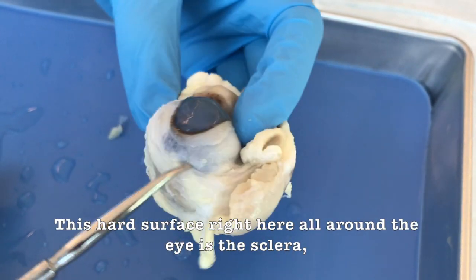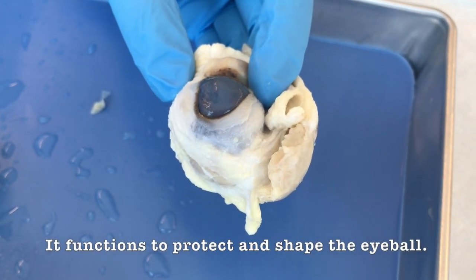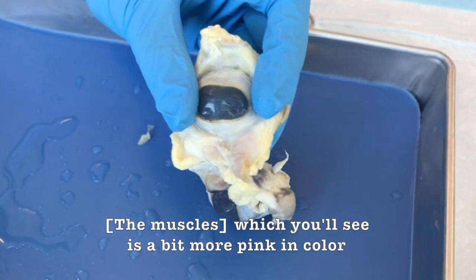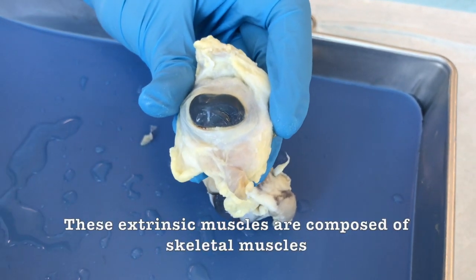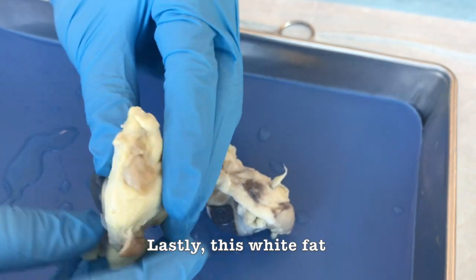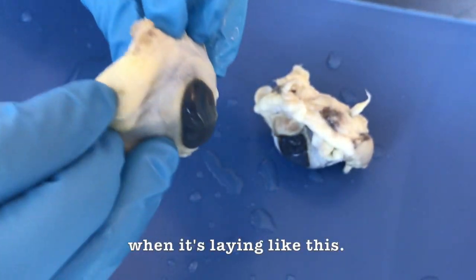This hard surface right here, all around the eye, is the sclera, which is the posterior covering of the eye, and it functions to protect and shape the eyeball, and it also anchors the extrinsic muscles that you can see better on this sample, which you'll see is a bit more pink in color compared to all the white fat around it. And these extrinsic muscles are composed of skeletal muscle and basically control the movement of the eyeball. And lastly, this white fat you see around the eye is the periorbital fat, which cushions the eyeball in the eye socket of the skull when it's laying like this.